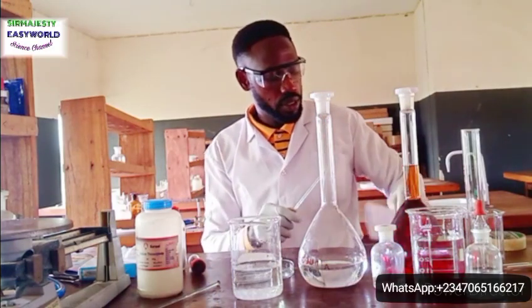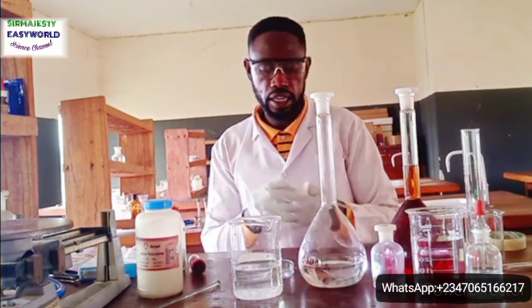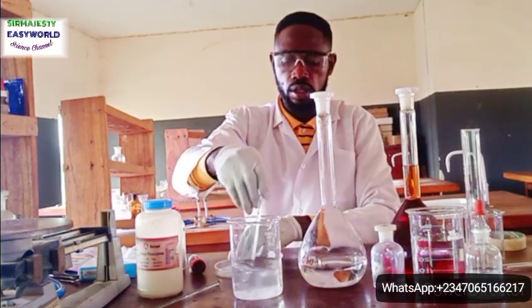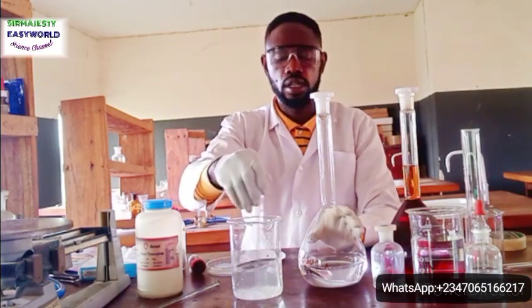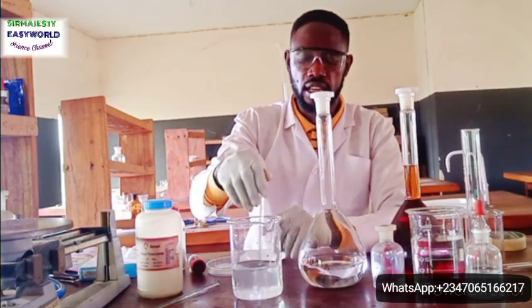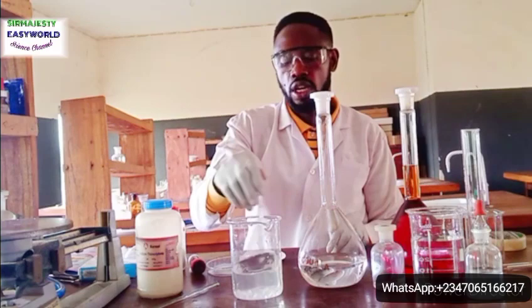So what do I do? Remember, you have to wash. I've washed all these things before starting every measurement. Wash well before any measurement. So I'll stir this. When it becomes completely dissolved, I will transfer it here, then add up to 1000. The job is done. Correction, don't fill this to 1000 and add that 24.82. See, am I right? And add the 24.82, yes, of course.